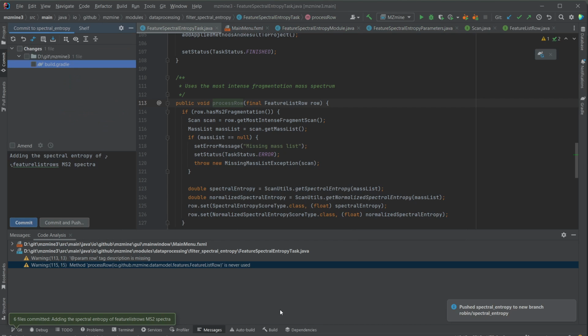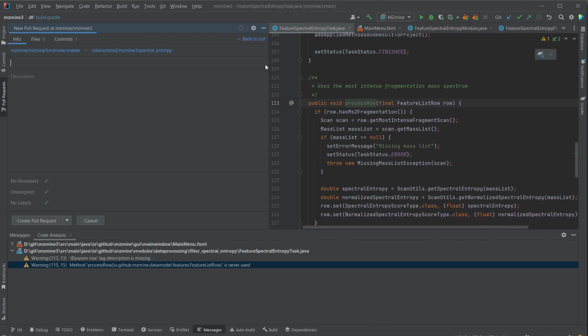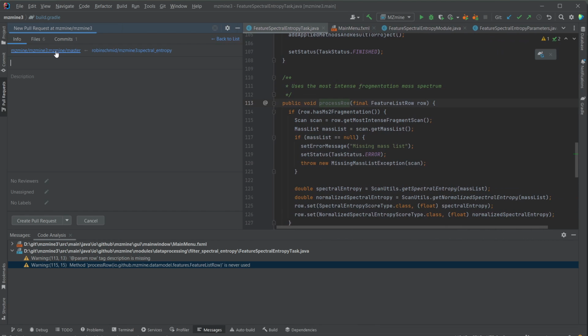If we push the commit, there's now two options for how we can create the pull request. And I think a very nice and easy option is just going to the pull request menu here. We can press the plus button up here, and in here, you should find something like MZmine, MZmine 3 master, MZmine master, and then your account, MZmine, your branch. And this means that from GitHub to GitHub, we're going to create a pull request between these two branches. And of course, we're going to describe it here: spectral entropy for feature list rows.